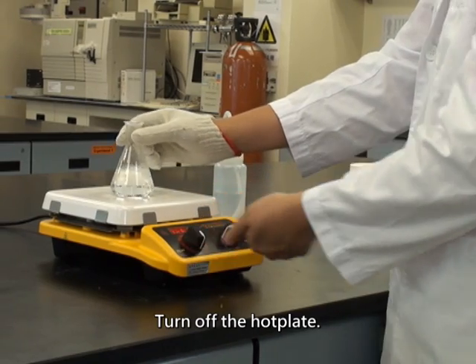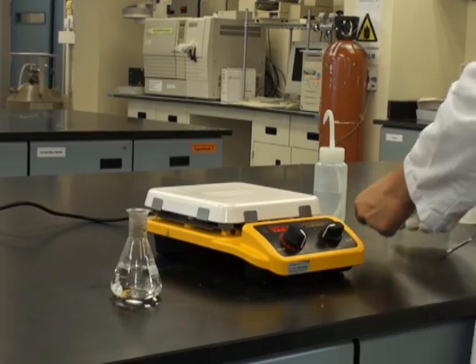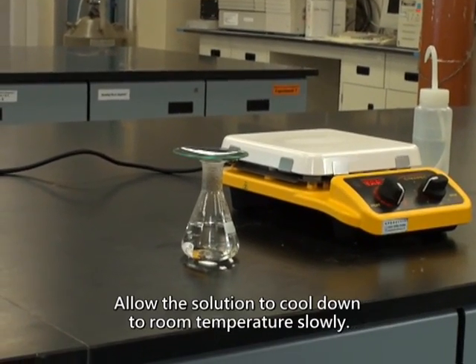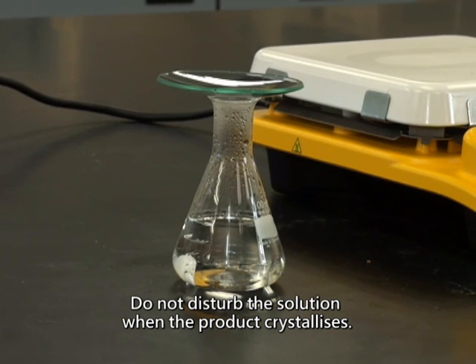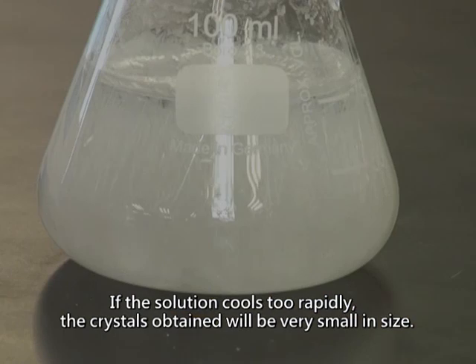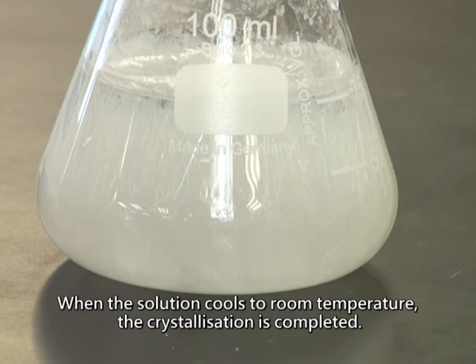Turn off the hot plate. Place the flask on the bench. Cover the conical flask with a clean watch glass. Allow the solution to cool down to room temperature slowly. Do not disturb the solution when the product crystallizes. If the solution cools too rapidly, the crystals obtained will be very small in size. When the solution cools to room temperature, the crystallization is completed.